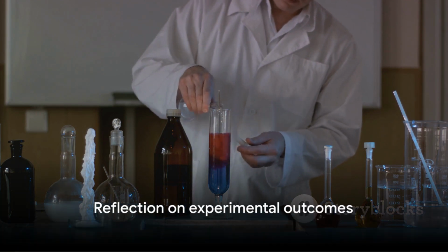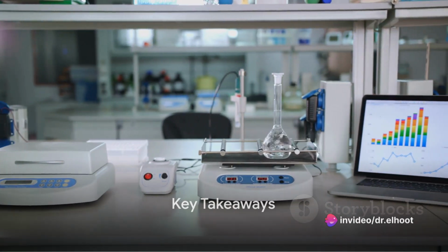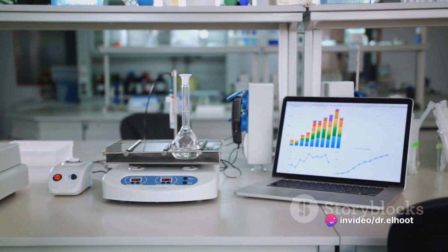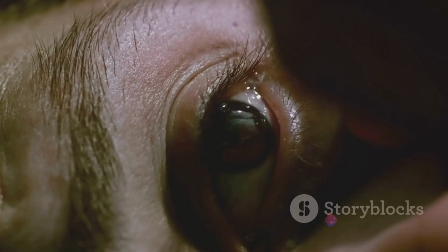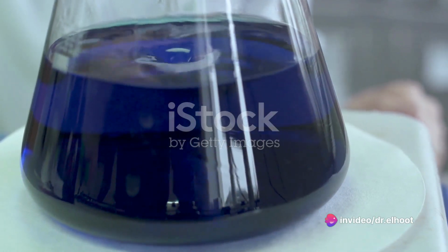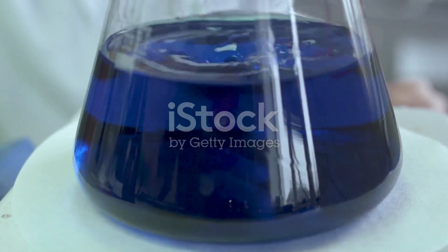But what have you learned from this experiment? Complexometric titration might seem complex, but once you grasp the steps, it becomes a straightforward process. Let's recap what we've learned. You start with a diluted sample solution of Zinc Care® eye drops in a clean conical flask, making sure to adjust the pH to 10 using an ammonia buffer.